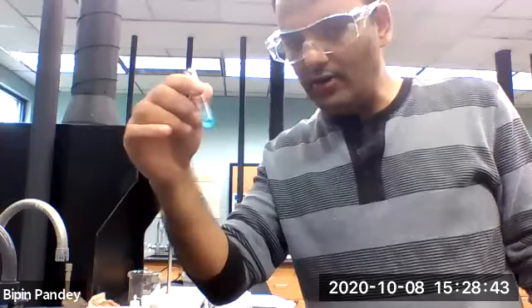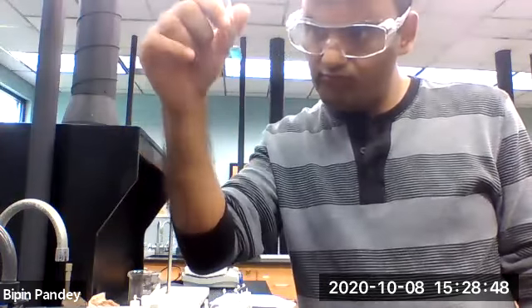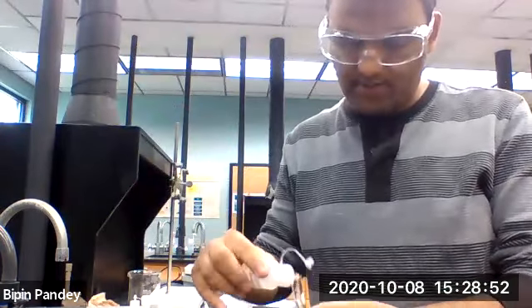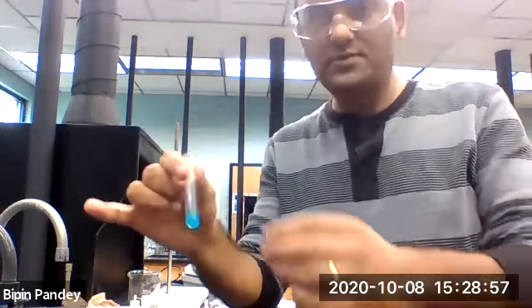Cloudy blue precipitate, that's what I can see. So I would say there's a reaction, it forms some kind of blue precipitate.